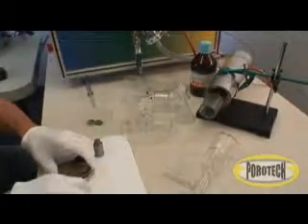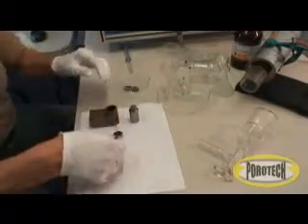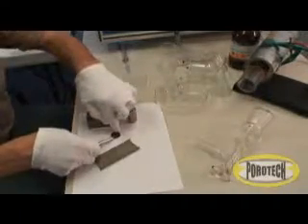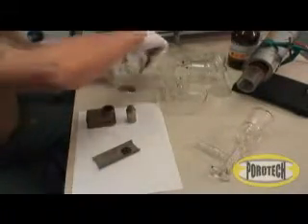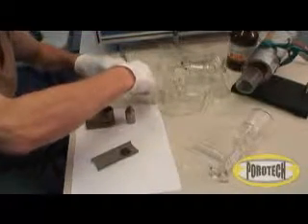This procedure is applicable to various paper or cloth-like materials. With other materials, the samples can be cut with scissors, saws, or lasers. We can also test powders or fragmented materials that are packaged in a special 23 mm disc envelope.